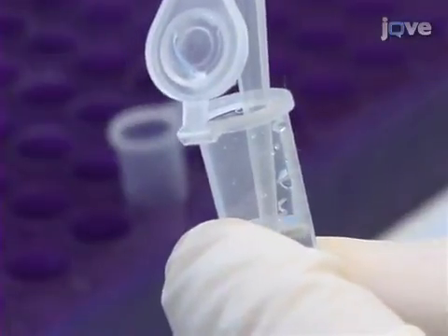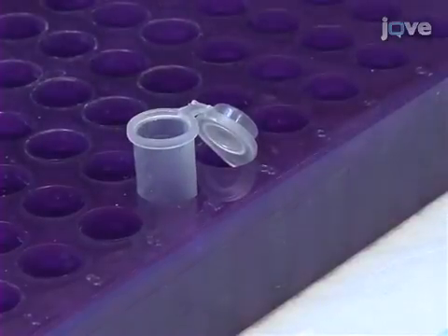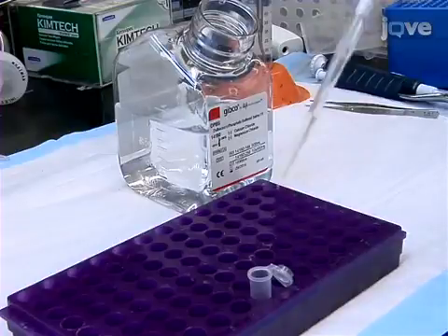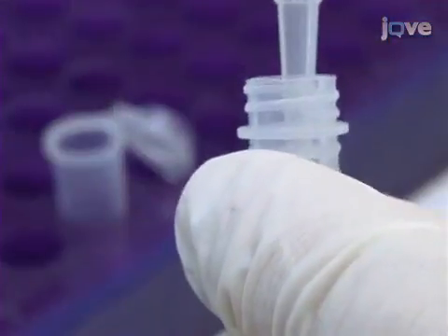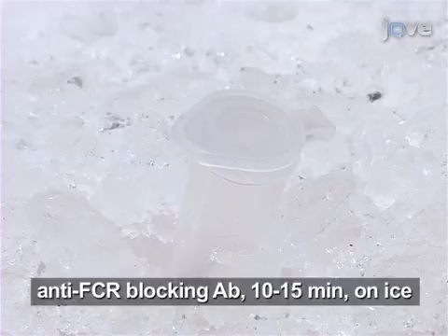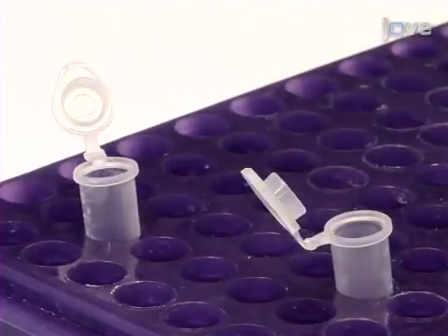Begin by transferring 50 microliters of the density gradient sorted cells into a new 1.7 milliliter Eppendorf tube and add 350 microliters of FACS buffer to the tube. Then, after adding 5 to 10 microliters of anti-FcR antibodies to the tube, incubate the cells for 10 to 15 minutes on ice. Split the cell sample into 2 Eppendorf tubes.